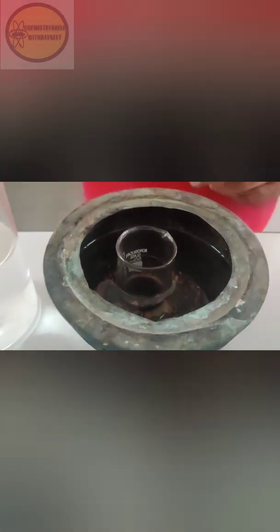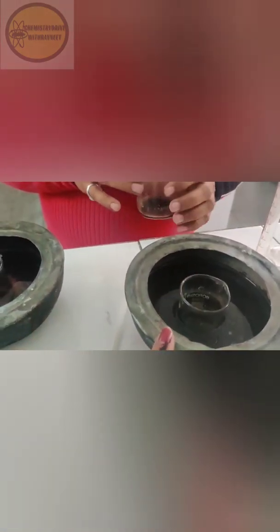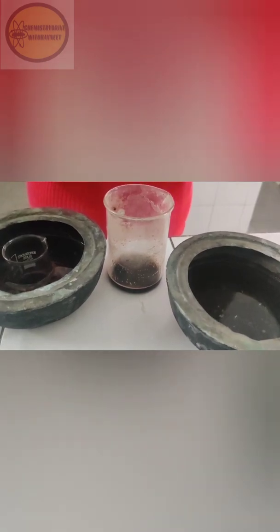Now prepare the solution of dimethylaniline: take about 1.5 ml of dimethylaniline and dissolve it in 5 ml of dilute HCl. Keep this dimethylaniline solution on the ice bath to cool. Then, mix the sodium nitrite solution into the sulfanilic acid solution to complete the diazotization.